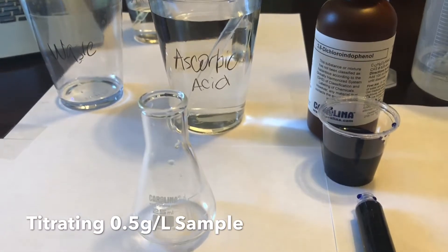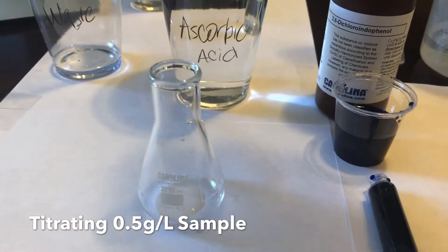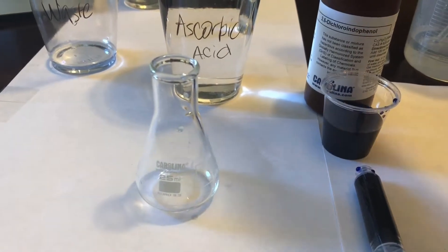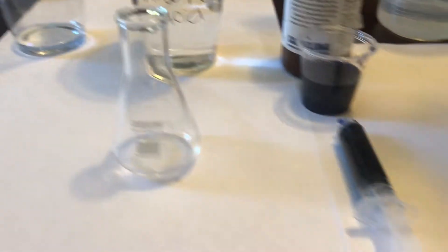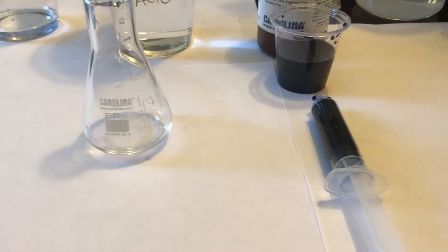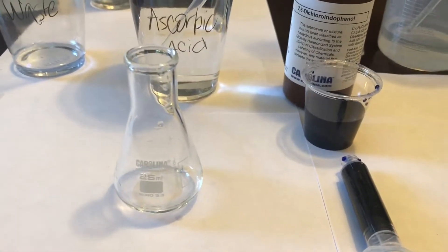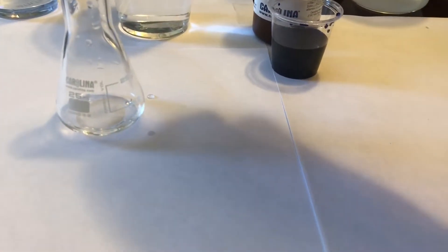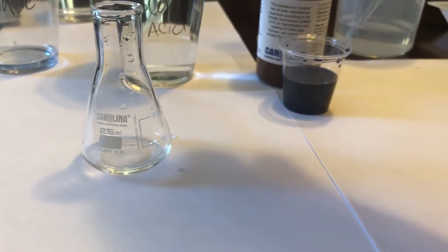We're going to put 0.5 ml of ascorbic acid into the Erlenmeyer flask and begin our titration for the 0.5 grams per liter ascorbic acid sample. Put 1.5 ml of pure water. Now we add the DCPIP until it's the color of what we saw in our preparation part.